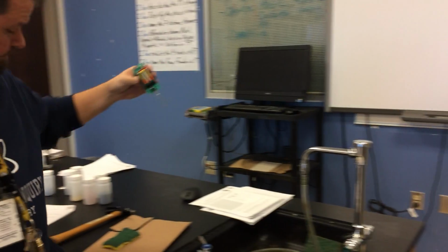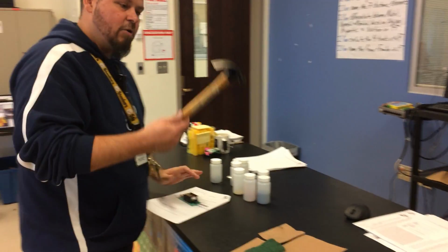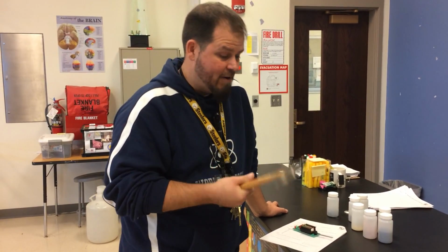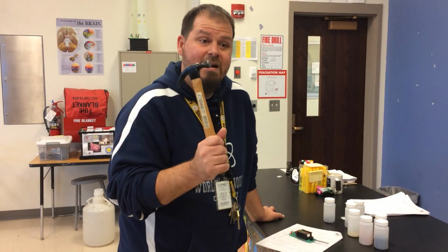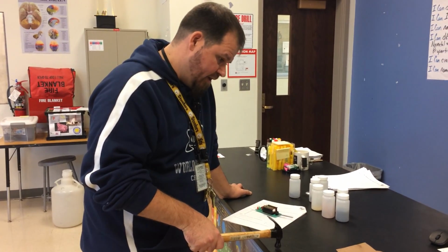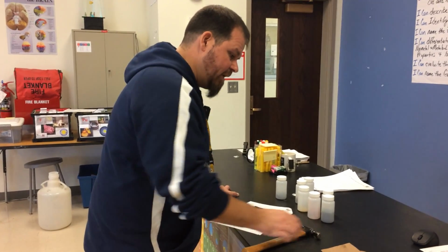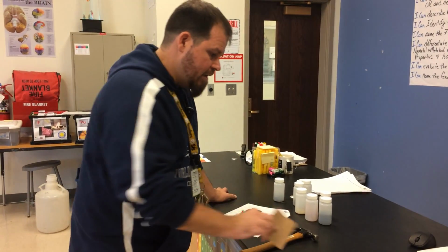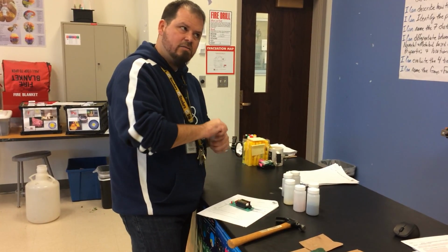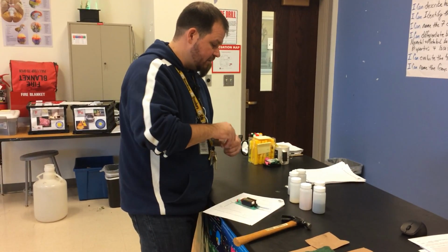Yep. Sweet. Conductivity tester. Good old-fashioned hammer. This, we're going to test how well you can operate safely in lab. I don't want this thing slamming around. I don't want you hitting each other with it, and I don't want you breaking the table with it. So we're going to use it light. Okay? And we also have some sandpaper, because I want you to be able to remove the oxide layer in case one exists, to see if it's actually metallic or not.